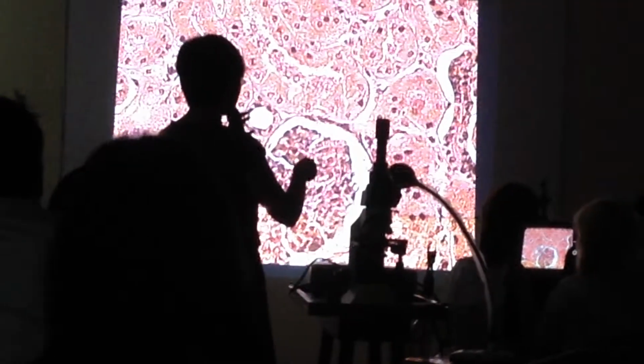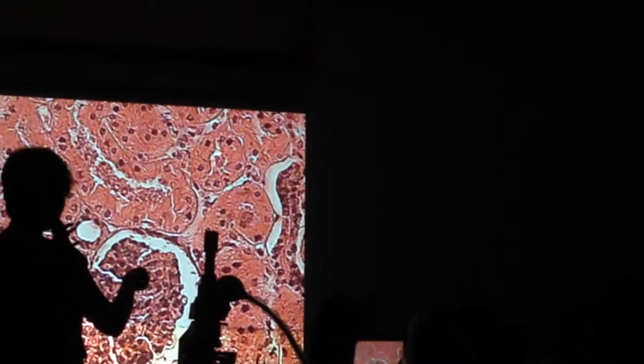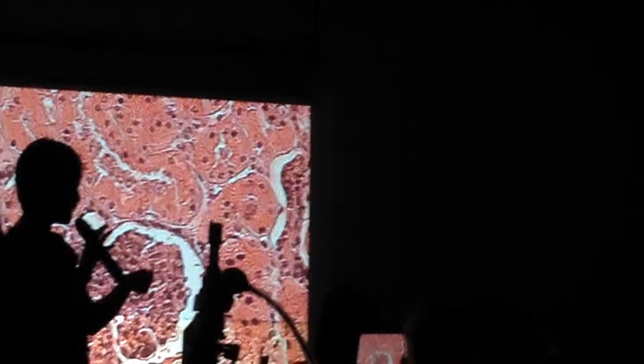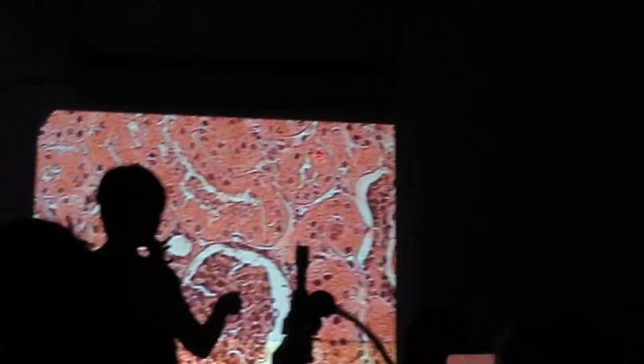But look at the other tubules surrounding it. Like this one. Do you notice that the lumen is almost pinpoint or slit-like? And then look at the location of the nuclei. Instead of being basally located, it reaches the middle or almost to the top of the lumen. So parang nag-move yung nucleus.